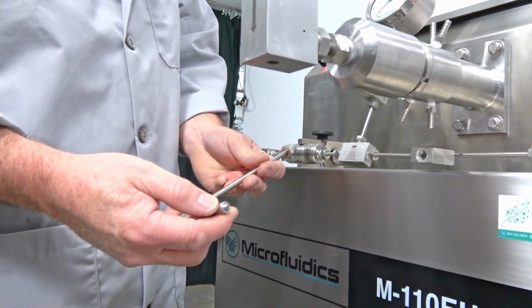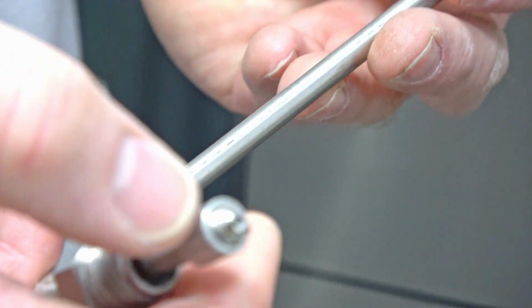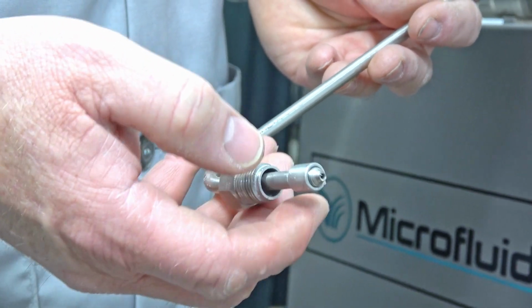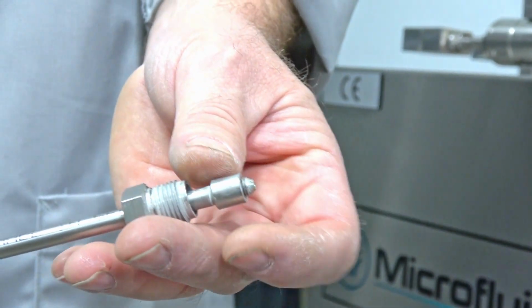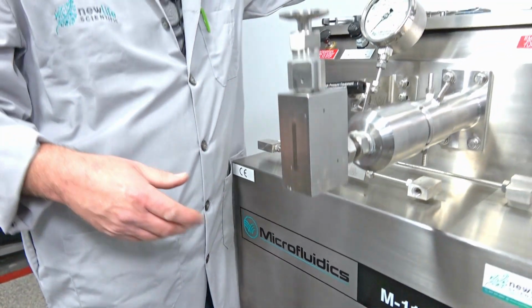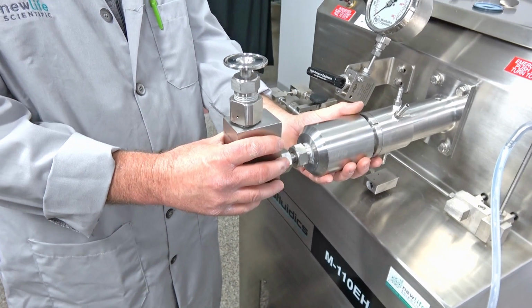And then we're going to look at this again on the videos I've done in the past, setting that collar there a couple threads in, so that you can get a good seal on it again before you reinstall them. So we're going to set this aside up here. And now it's pretty much loose here. We're going to just spin this whole assembly off.